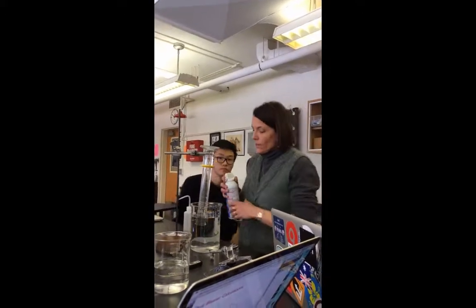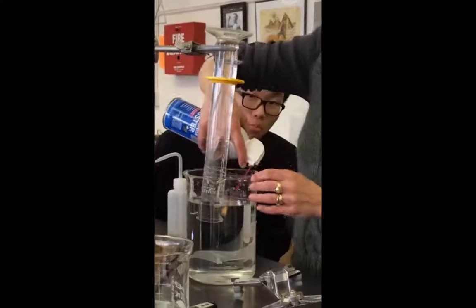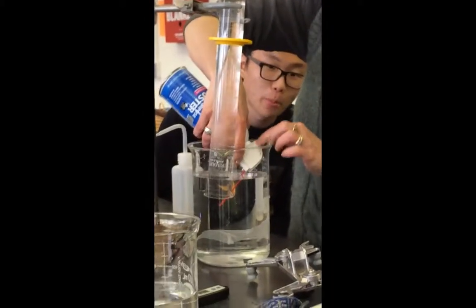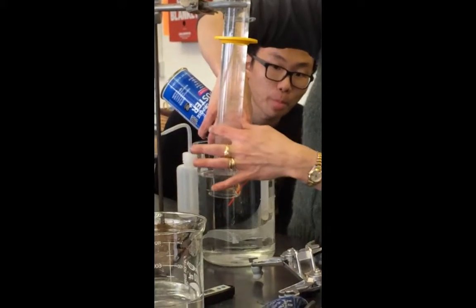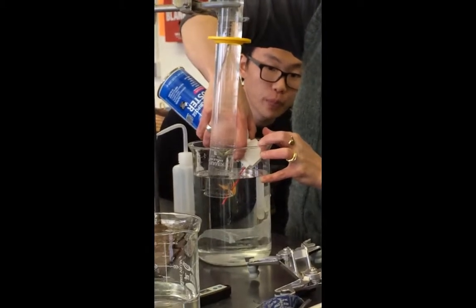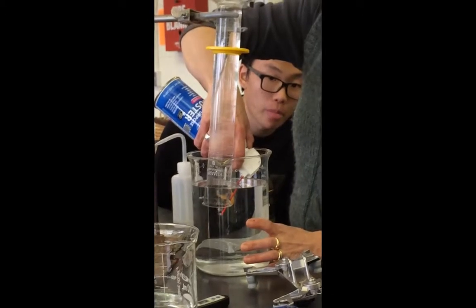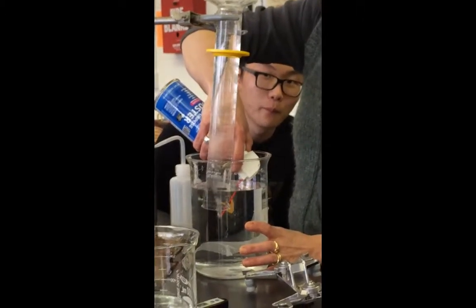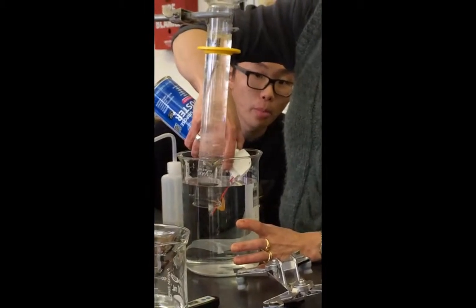So now here's the big tricky part. This is the hard part. I'm going to take the dust blaster and put the gas into the graduated cylinder until we have about 250. Just make sure I don't go over the mark. Okay, ready? Here we go. Look at that. There it comes. Whoa. This is what we call years of experience right here.